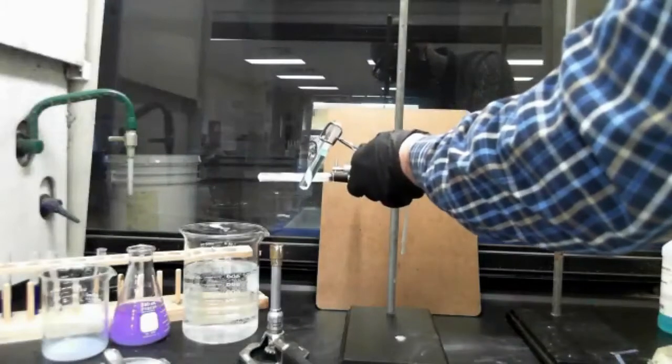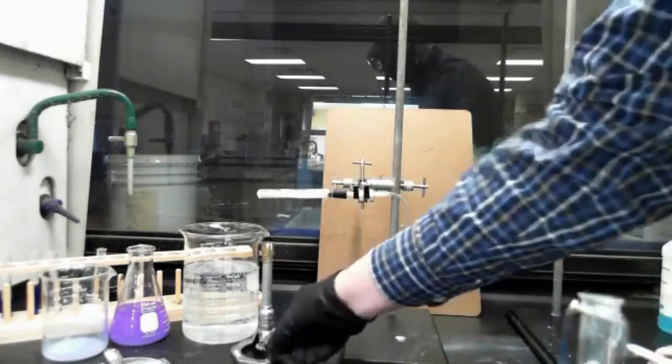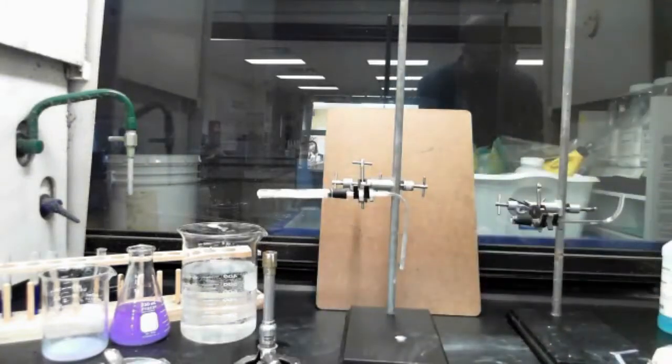I actually want to lower this slightly. And I'm going to light this Bunsen burner and stick it under there and then we'll see what happens.